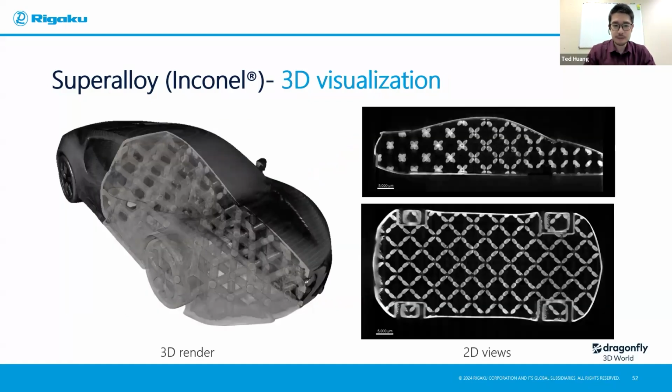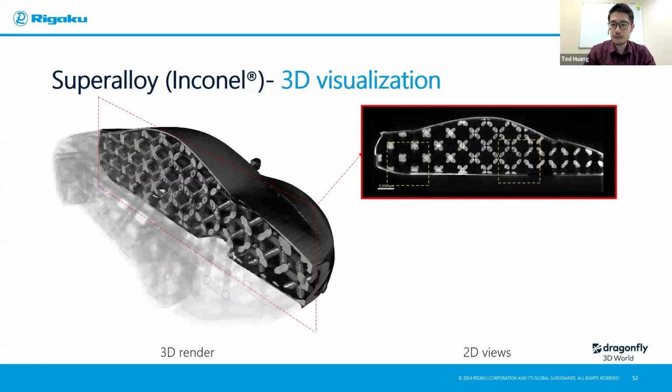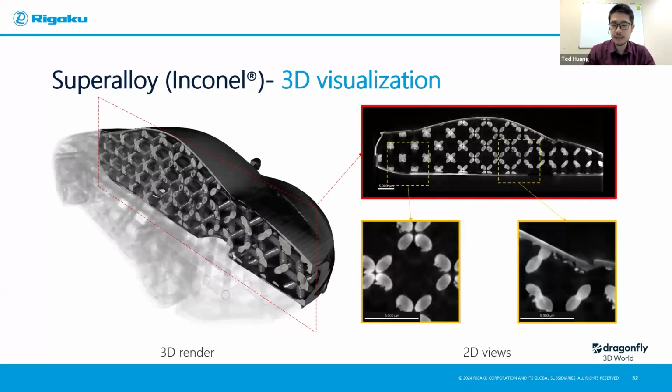On the left is a 3D render just to give you an idea what the car looks like, with some transparency to show you the internal structure. So it's not a solid piece. It actually has some grid-like structures, as you can see here on the left and also on the right, using the 2D cross-sectional views. If we focus on the 2D cross-sectional views and zoom in, you can immediately tell there are some areas inside these grid-like structures that have some irregular surface bumps, likely again not completely fused powders, and the surface treatment after the printing can only address the outside of the car, right? So the internal of the car is still like that.